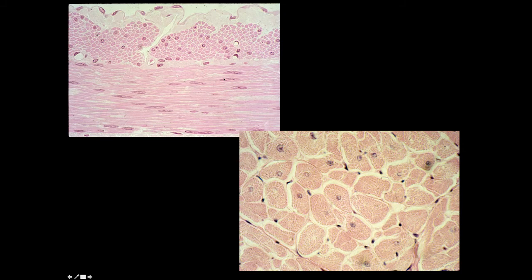I've shown you these two slides before, but now I put them on the same image. These are at the same magnification. Here's the cardiac muscle cell. Look at the size of the cell. Look at the relatively small nucleus in relation to the size of the cardiac muscle cell. On the other hand, look at the smooth muscle cells. Relatively same magnification. Look how much smaller the individual smooth muscle cell is, but look at how much larger the nucleus is. So the smooth muscle cell has a much larger nuclear to cytoplasmic ratio than the cardiac muscle cell.